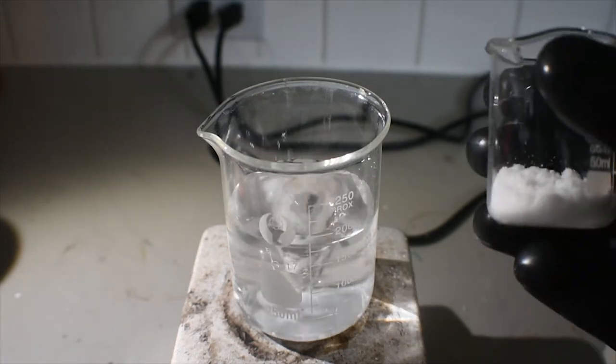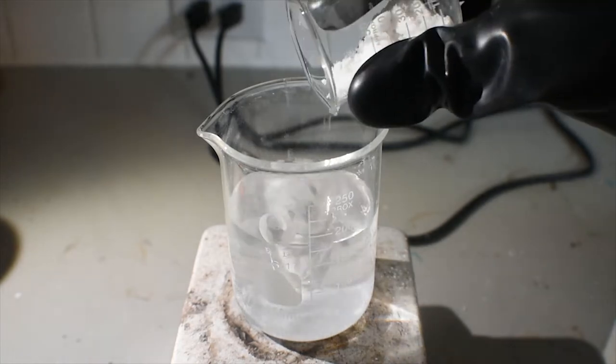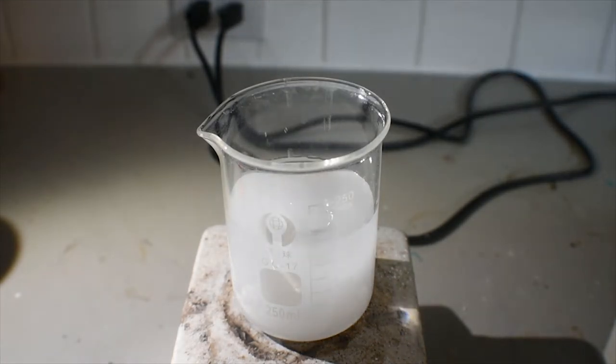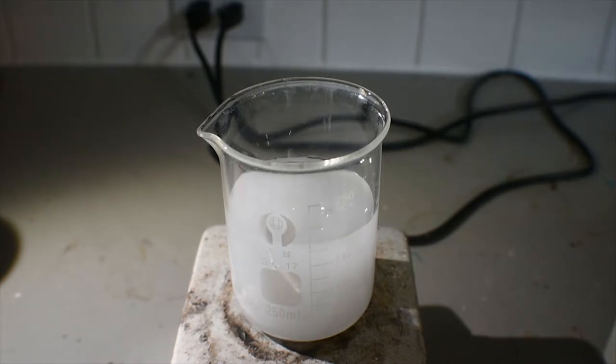Okay, next is the oxalic acid. This might take a little bit longer, as oxalic acid isn't quite as soluble as potassium oxalate. Once these are dissolved, I'm going to go ahead and add the potassium dichromate. To get everything to dissolve, I might have to use some sort of heat to dissolve the oxalic acid.